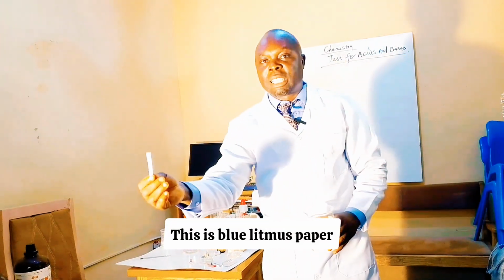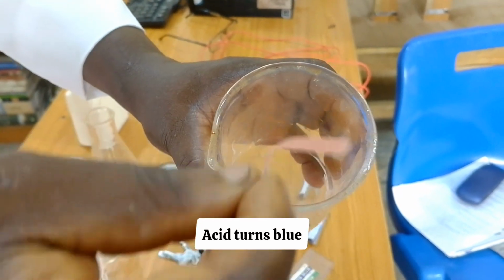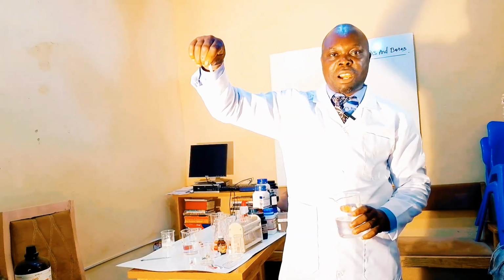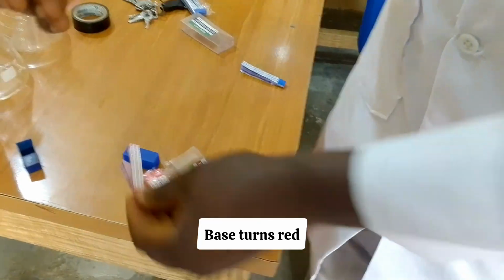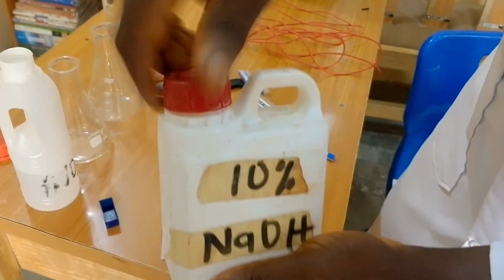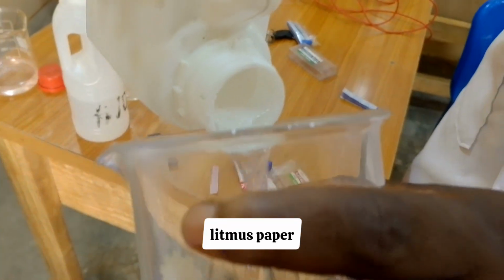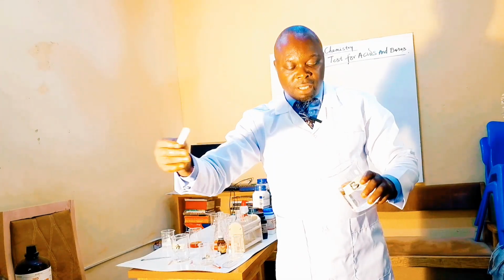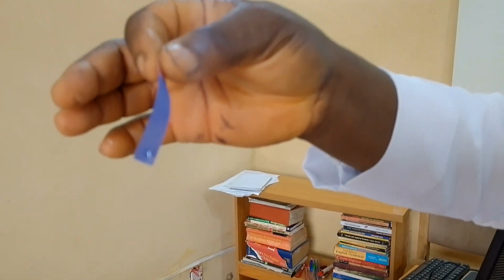This is blue litmus paper. Put it in the acid, it turns it red. Acid turns blue litmus paper red. Now, but base turns red litmus paper blue. Base turns red litmus paper blue. This is red one. Soak it here. It turns blue.